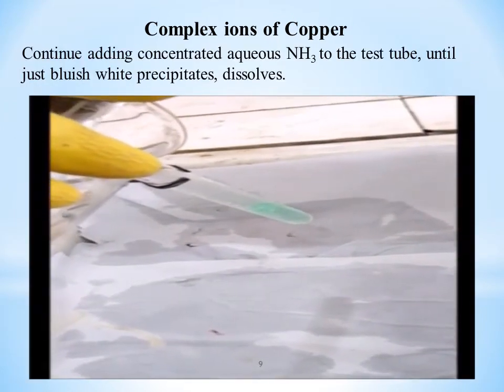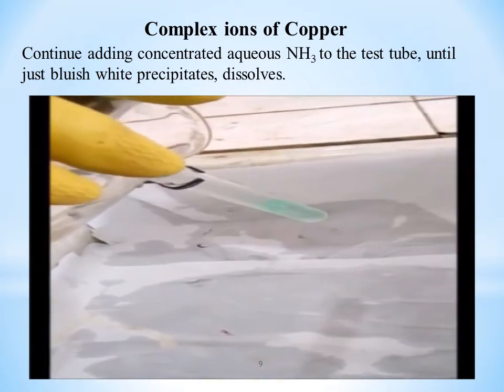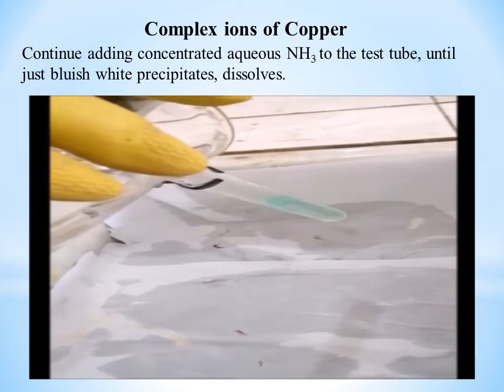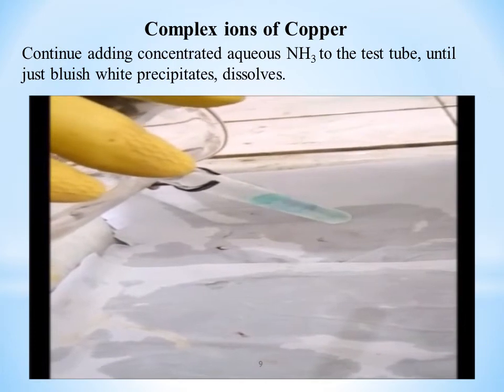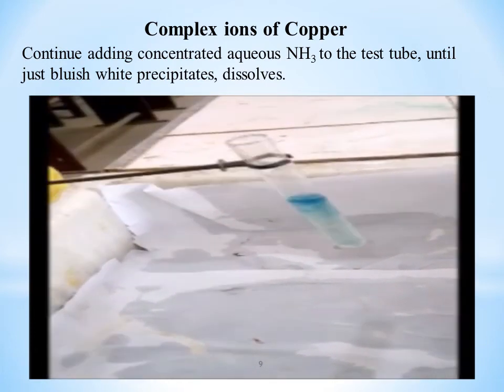Continue adding concentrated aqueous ammonia to the test tube. What happens? The bluish white precipitate will dissolve. In the previous video you saw the appearance of bluish white precipitate in this test tube.